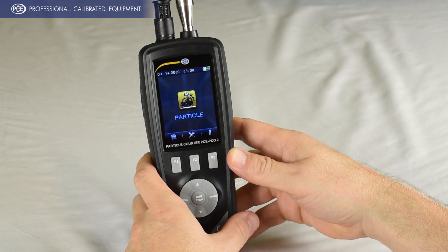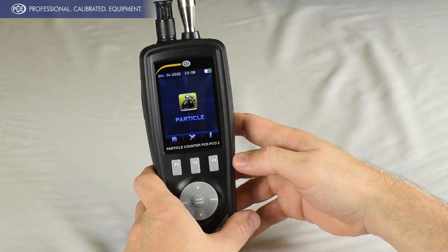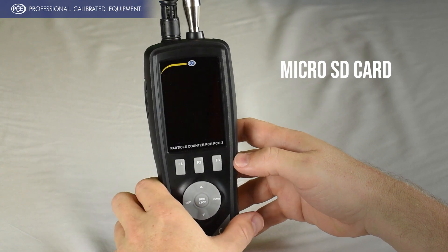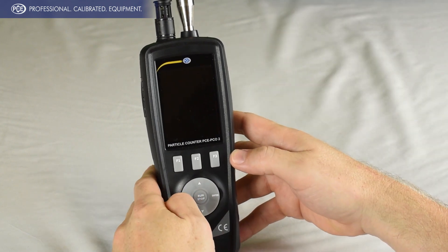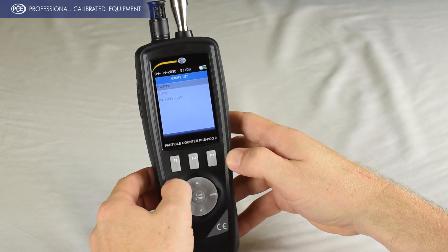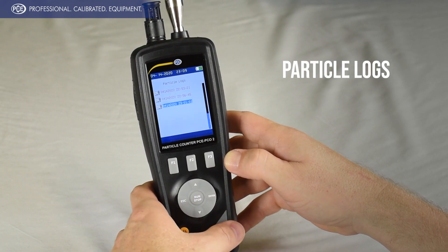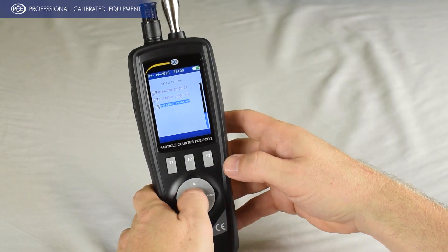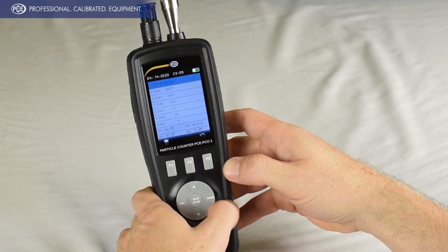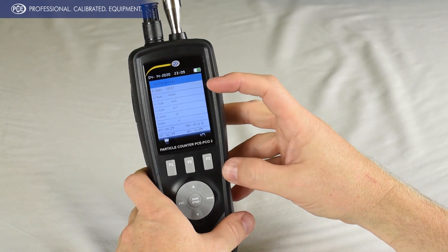Once the sample is complete, it automatically saves to the internal memory of the device. You can increase that memory by adding a micro SD card, which is in the battery compartment. To access the particle logs, click on F1, scroll down to particle logs, and hit enter. There are the three samples we just ran. It's got your date, time, temperature, humidity, and then all your particle counts.